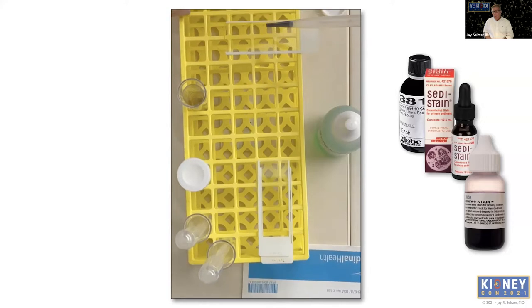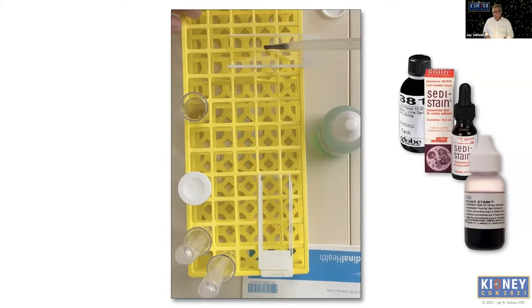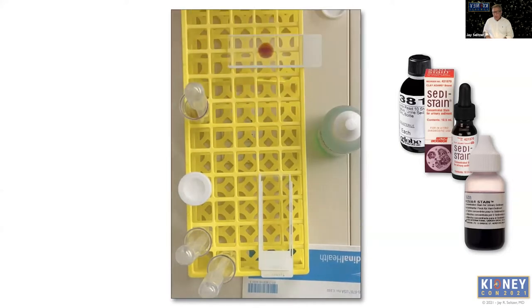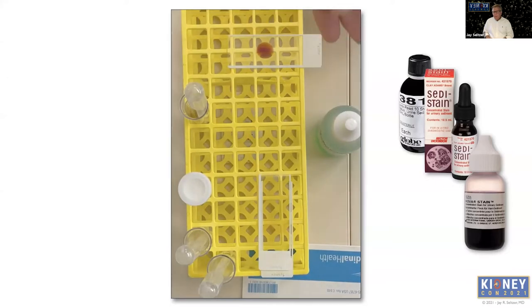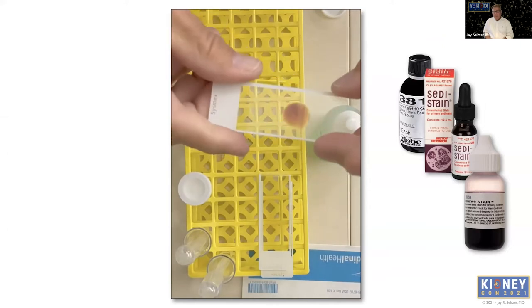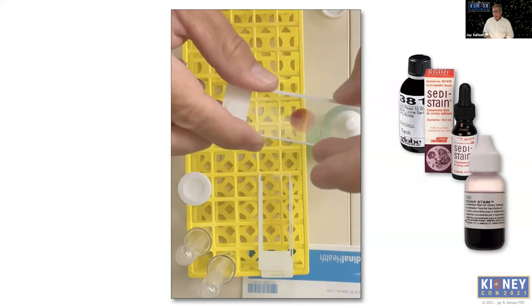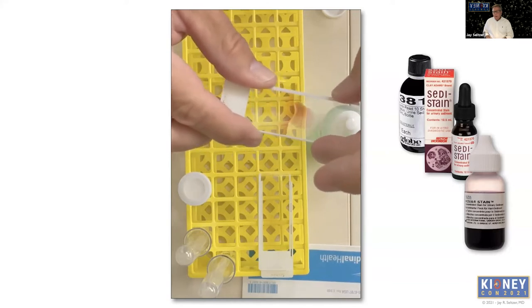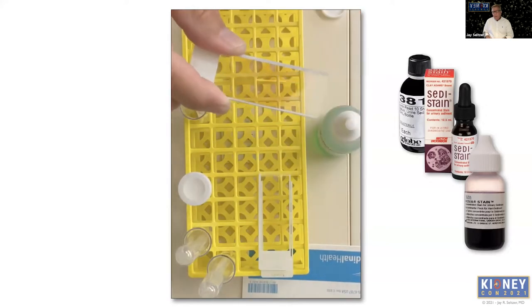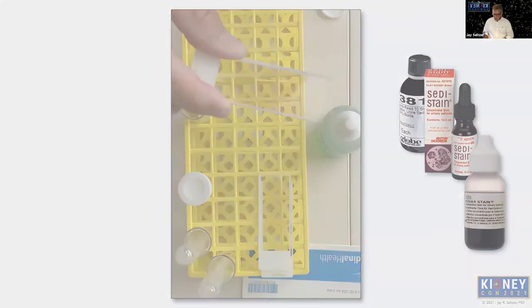Remember, when you put the drop on the slide and apply the coverslip, you want a very thin layer — the thinner the better. Because under the microscope you have a very limited depth of field and a single focal plane, you only want one plane of items. Apply the coverslip by putting one edge down, tilting it so the drop meets the corner, then lowering the other side — that's the best way to prevent air bubbles. If there's an air bubble, the coverslip is at an angle and you don't get good depth of field.